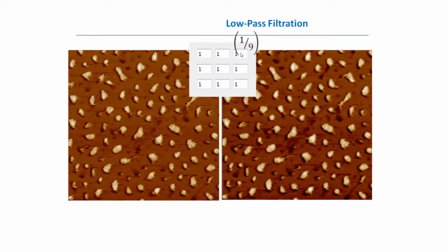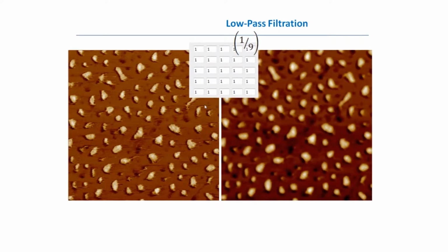I just want to note that in our software we use normalized filters, because if you apply this filter directly, you will get the wrong result. So for this 3x3 kernel, each weight is normalized by 1/9. And from the right side, you can see that this high frequency noise has gone. But what will happen if we apply a filter with a bigger kernel, like 5x5? We'll see that the image became even smoother, but we have lost some details already.